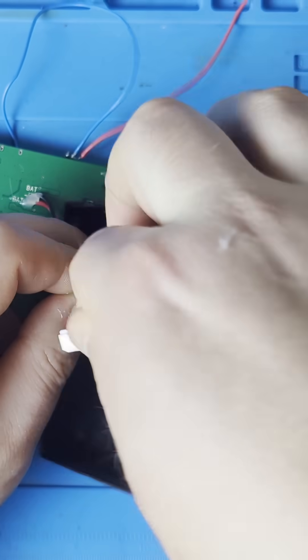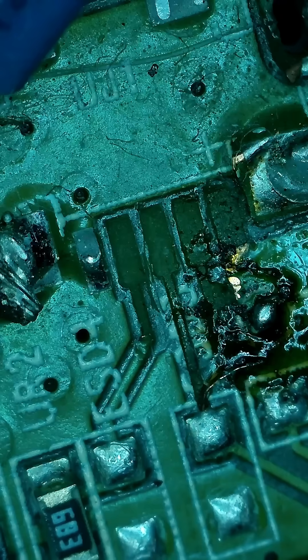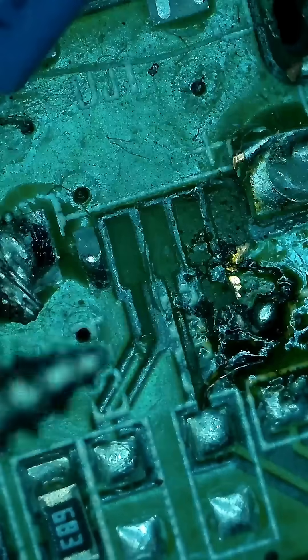I think this just pulls apart, and I think this is a great time to use the microscope. I'm gonna show you how one of the screws on the motherboard looks in comparison to this. Yeah, it looks giant — so these are really tiny traces.